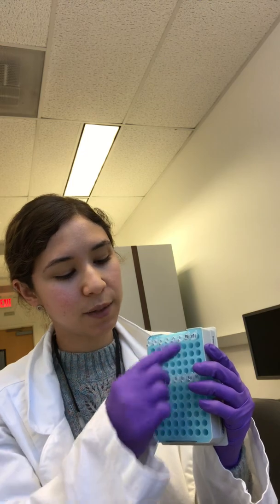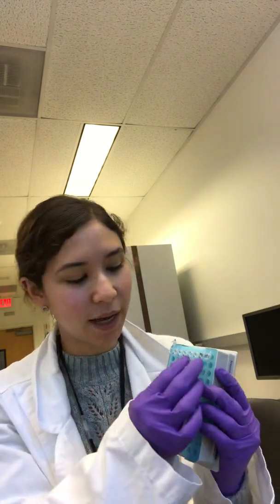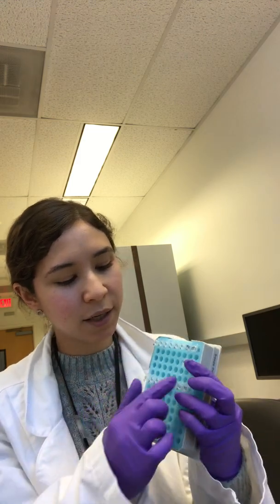When we're ready, when the master mix is made, when your tubes are nice and closed, at that point you can go get your product from your initial. You have to be really careful with the initial because this is amplified DNA and there's a high chance of contamination. Make sure you're in the right hood. We want to be in the dirty hood, not our clean hoods. So here is, let's say, our iPCR. We are just going to add 1 microliter into each of the corresponding tubes. So you would open up your iPCR, go in, pipette up and down 1 microliter, go to your NPCR and put your 1 microliter in. You do this for all of the ones on your initial. For your negative nesteds, we're just putting 1 microliter of nuclease-free water.